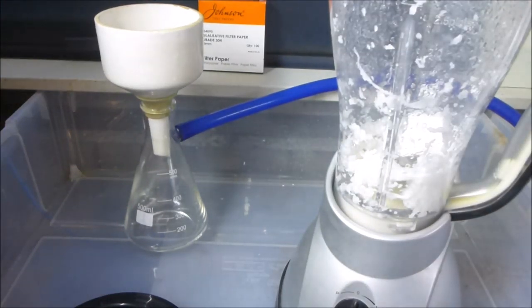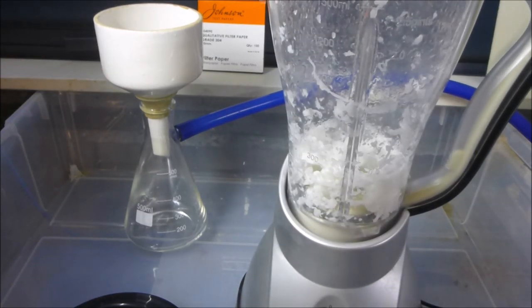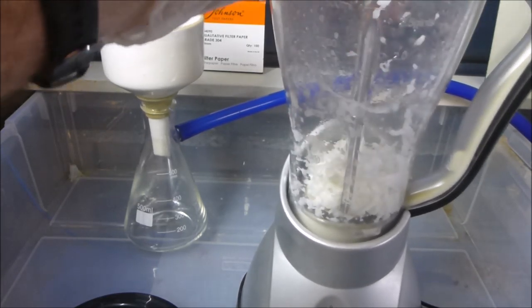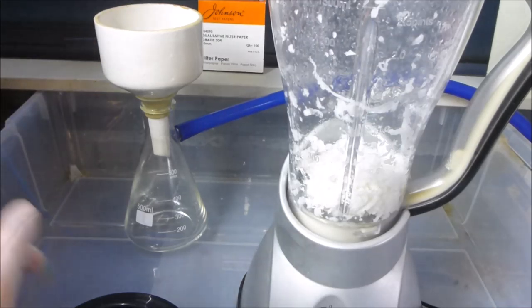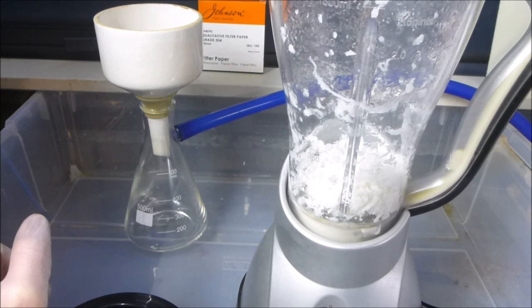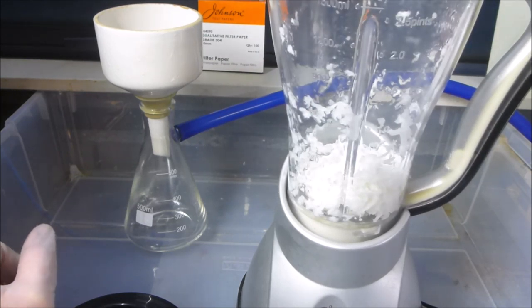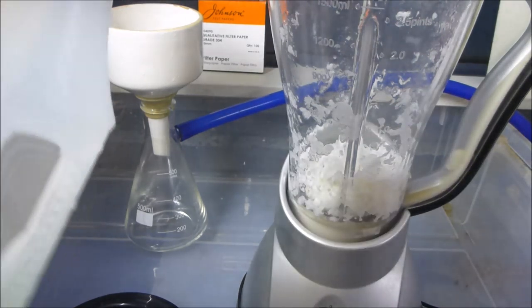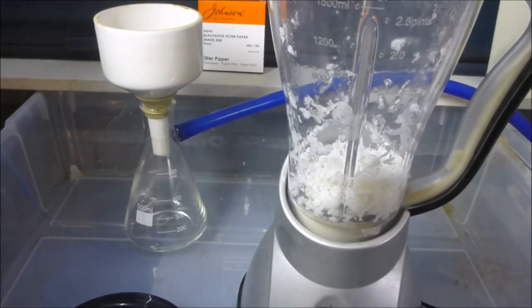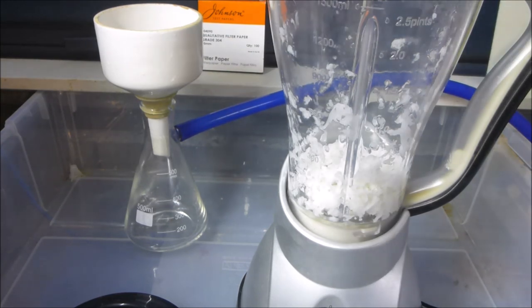Just when the lid's off, it's safe to jam your fingers in there. It's got an interlock. I think it's still looking a little bit stringy, but we'll mix it around a bit, maybe give it a little bit more water. Just with the spray bottle, I'm going to spray some of the stuff on the sides down. Actually, using dry paper towel in the shredder was not a particularly successful attempt. It would work okay, but it took quite a long time. I think doing it wet is pretty much the solution. Let's give it a little bit more water.